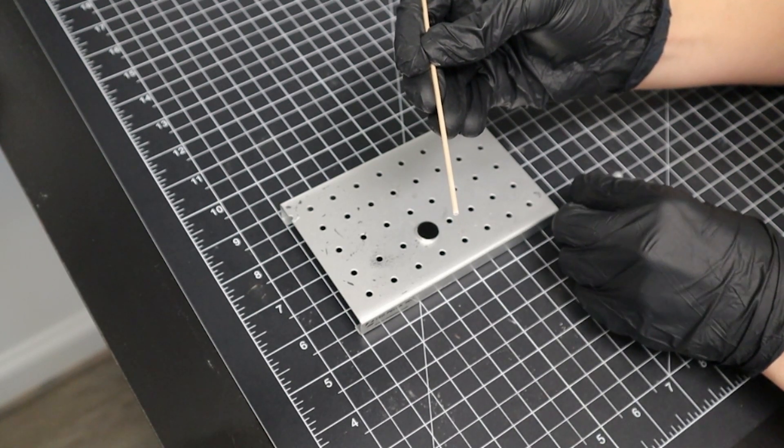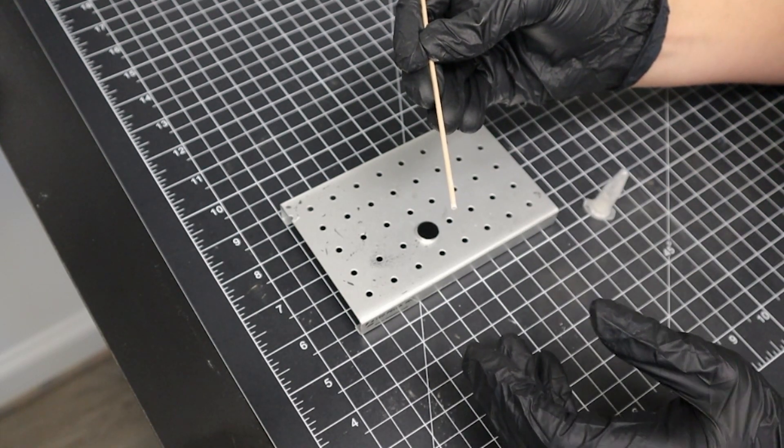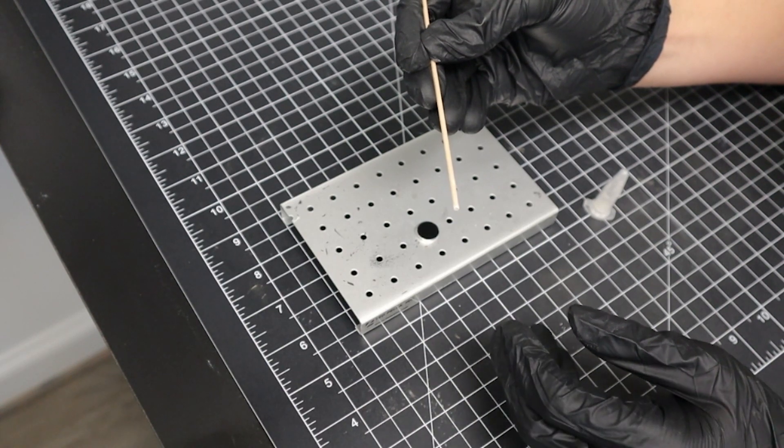If your particles are too large for this method, they will not stick to the wood, but the method can be used on particles that do adhere.